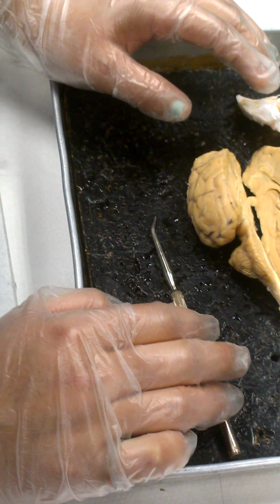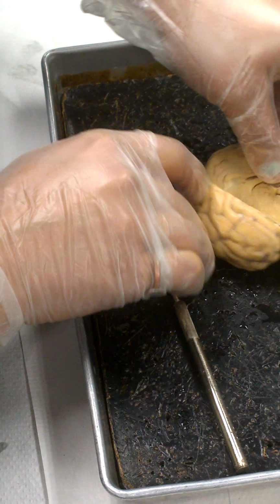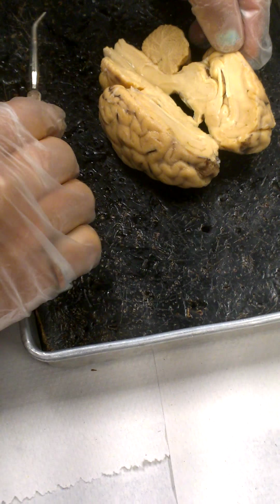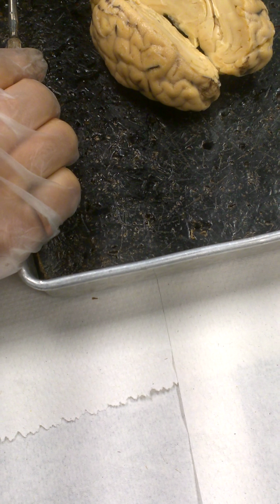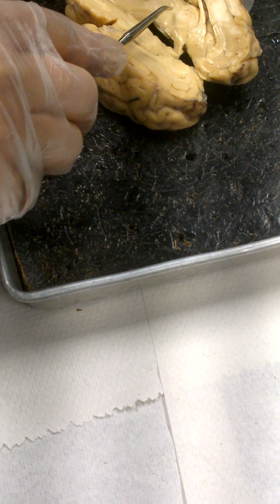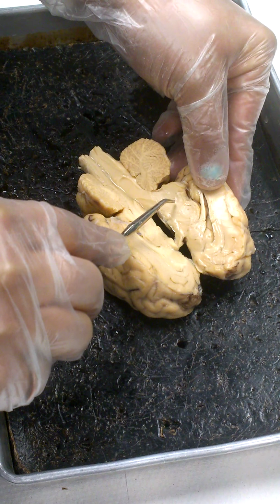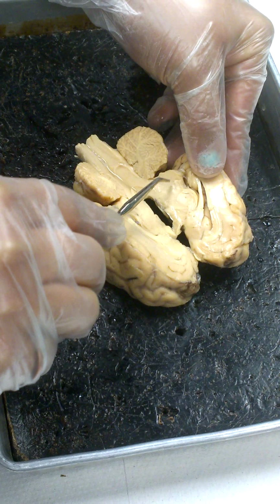More or less straight back from that, up into this region, there's a posterior commissure right in here. Another little small dot of white tissue. Between the anterior commissure and the posterior commissure is this very large mass. This is called the thalamus, or a portion of the thalamus. Actually, the thalamus continues back down into the hemisphere there, but this enlarged portion right here would be the thalamus.